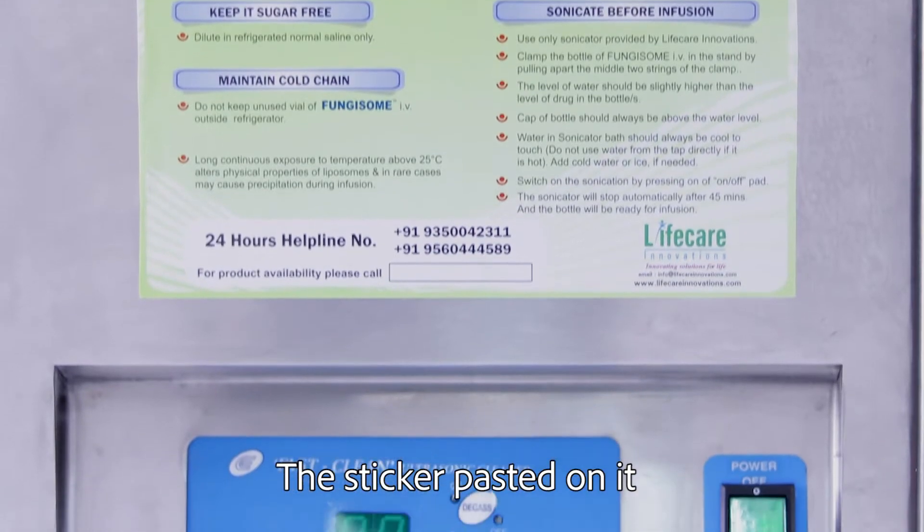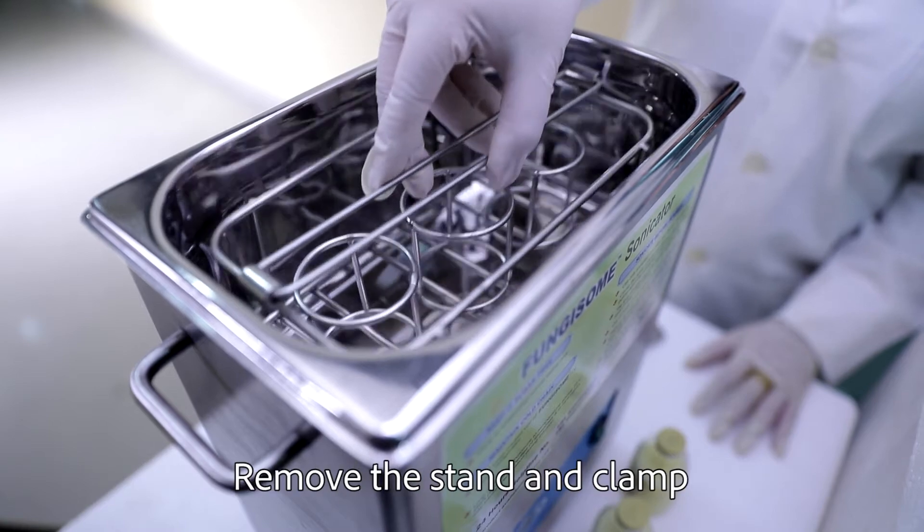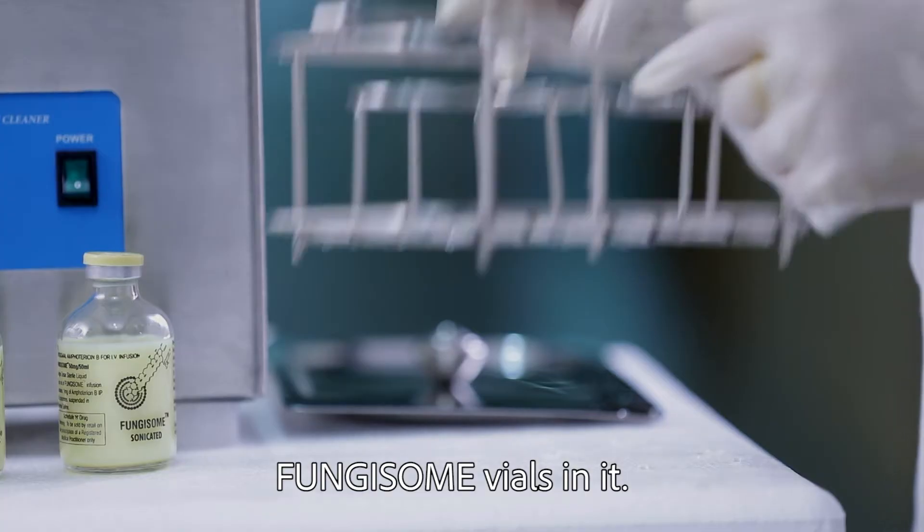The sticker on it describes the process. Remove the lid before and during sonication. Remove the stand and clamp Fungisome vials in it.